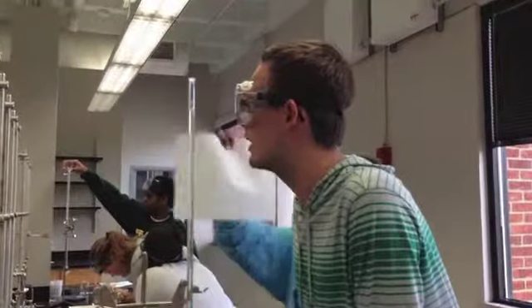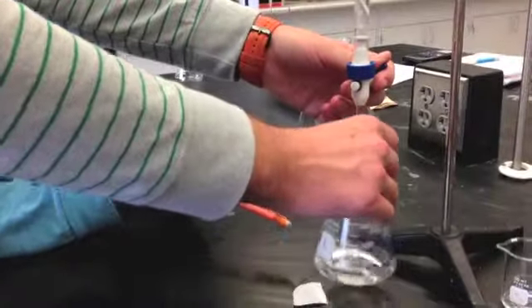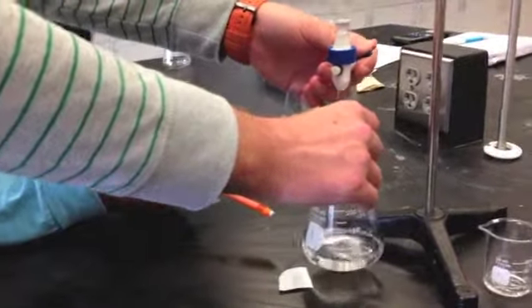You must then prime the burette by rinsing it first with water and then 3 times with a sodium hydroxide solution. The two solutions involved in a titration are called the analyte and the standard solution. The analyte often has the unknown concentration.